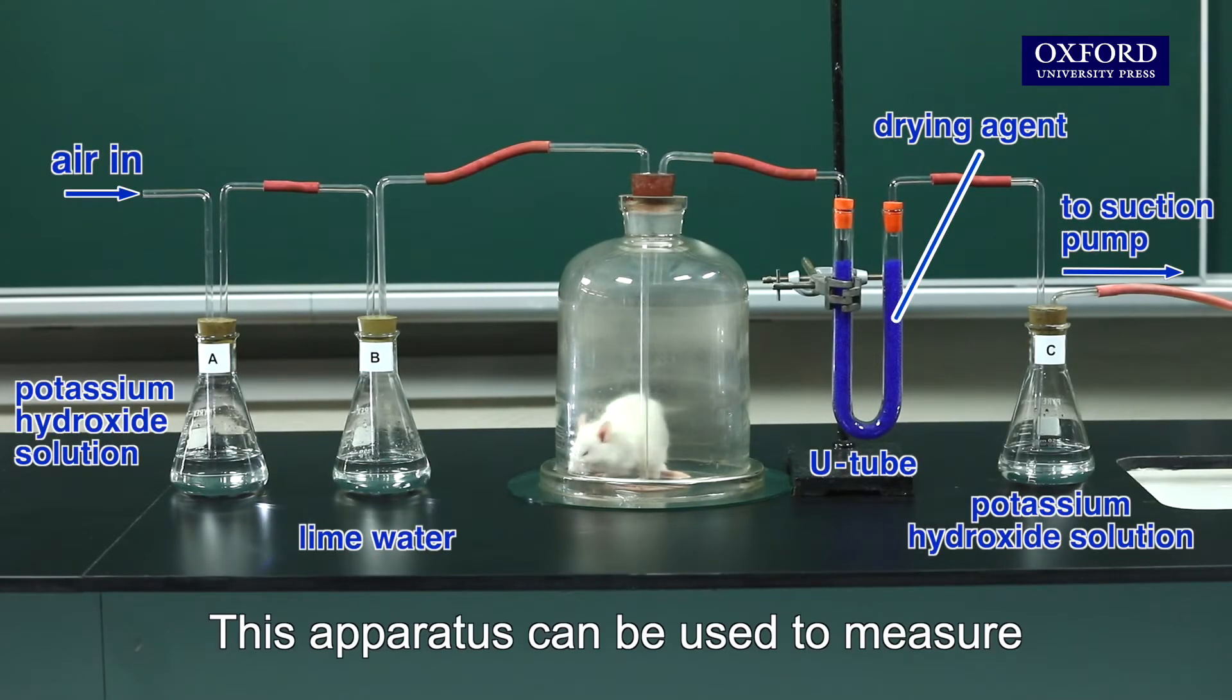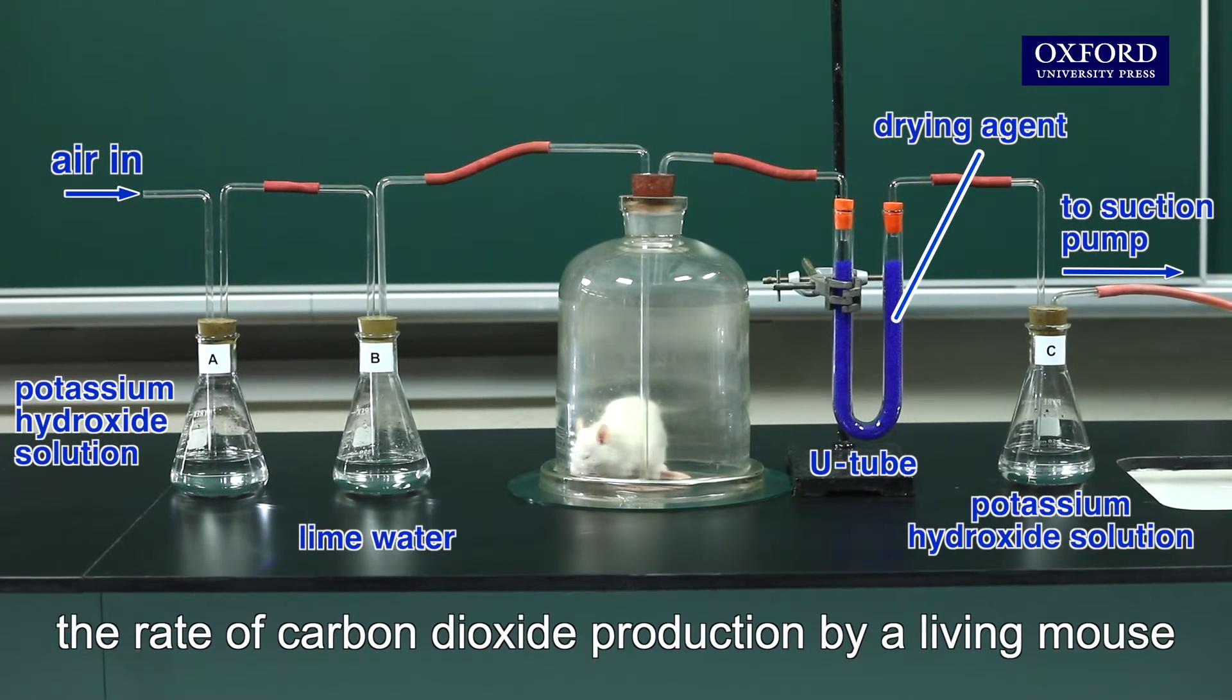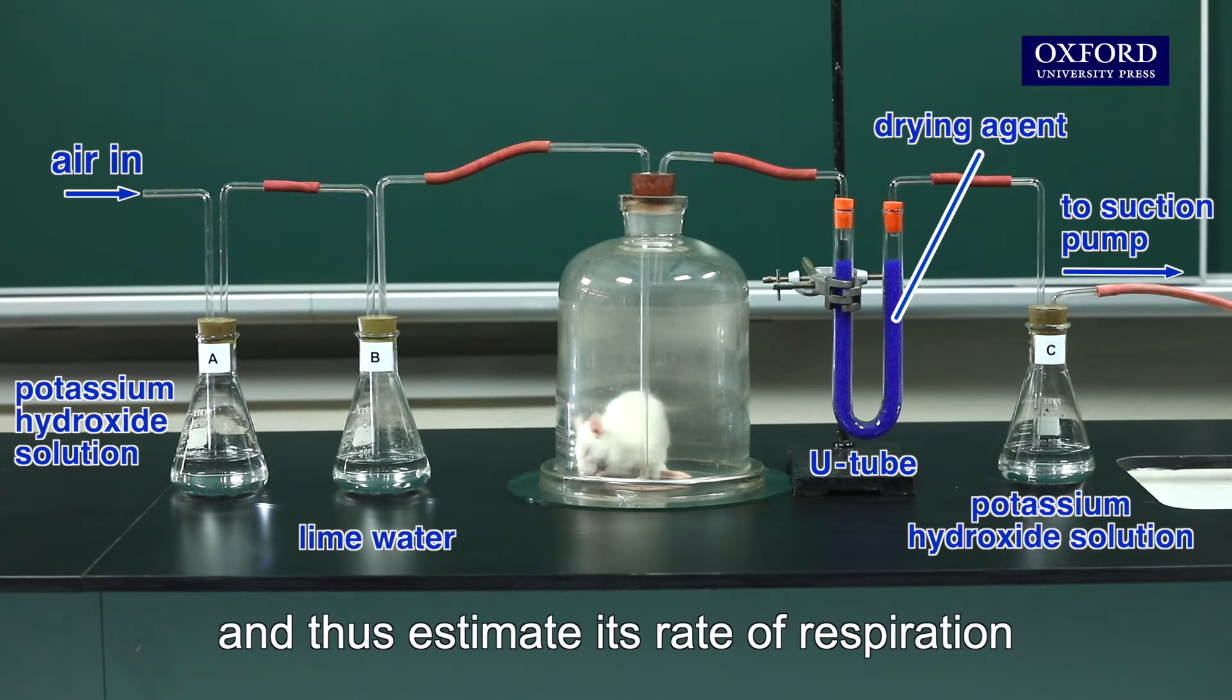This apparatus can be used to measure the rate of carbon dioxide production by a living mouse and thus estimate its rate of respiration.